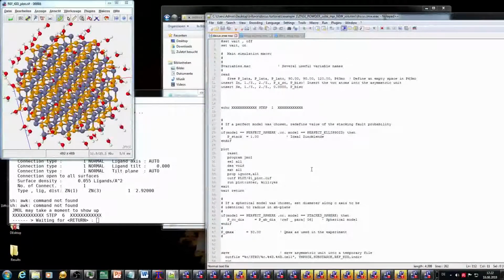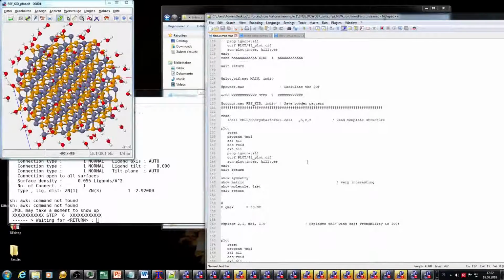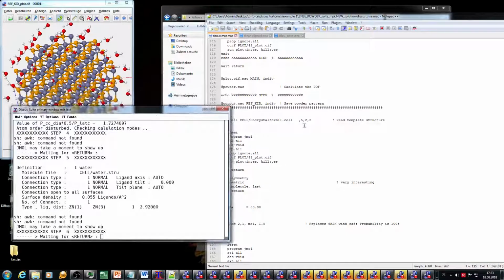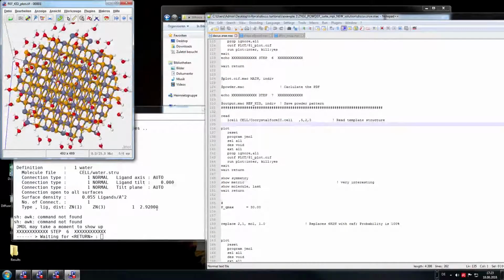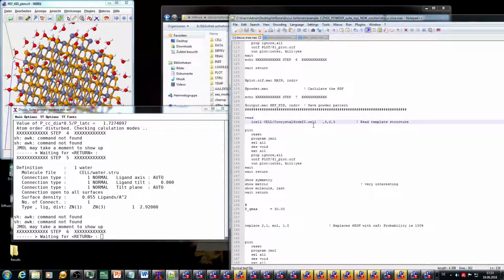Now we want to see what we can do by having more control over the crystal structures. What are methods to look at or prevent errors by knowing what you actually are working with, and probably don't use these pictures anymore because they don't give you the full information. We'll see that in a moment. The macro is going on now, so it reads now a second cell. It's the co-crystal cell, and it's going to plot it.